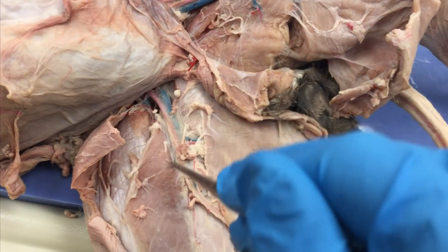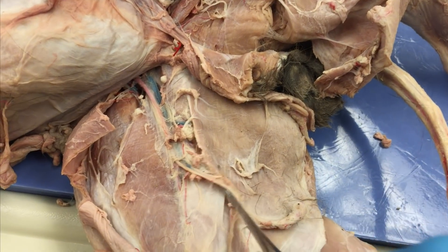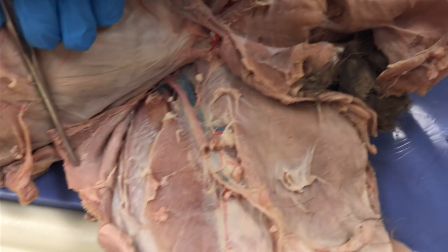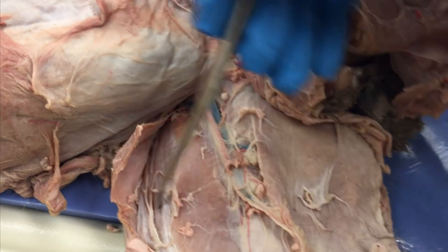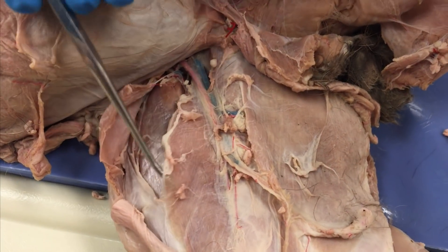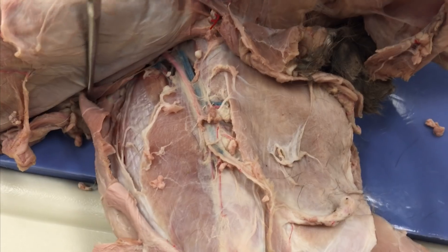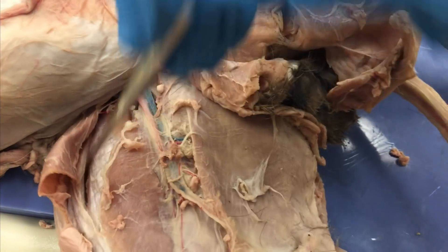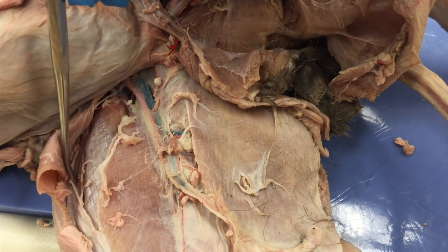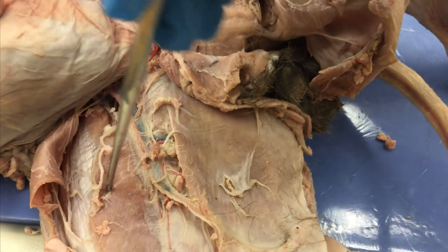Once we do that, it's kind of like with our biceps and triceps — we're going to use these vessels to let us know where the quadriceps and the hamstrings are underneath this gracilis. Starting with our quads, you're going to see this white shiny piece of fascia showing you where the rectus femoris is. There's a small indentation where you can slip your probe under to show the vastus medialis. Push your sartorius up and out of the way and you'll see a sliver of muscle — right back there — that's the vastus lateralis. So: lateralis, rectus femoris, medialis.